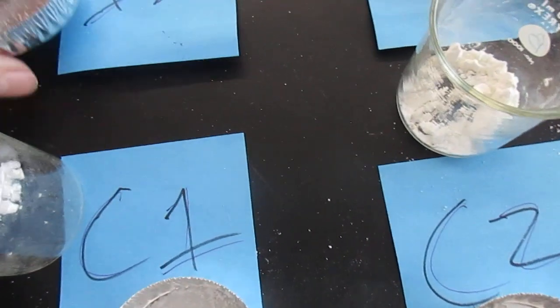Now let's look at them under the microscope. I will admit, this might not be the best, but I'm going to do my best to show you guys exactly what it looks like.